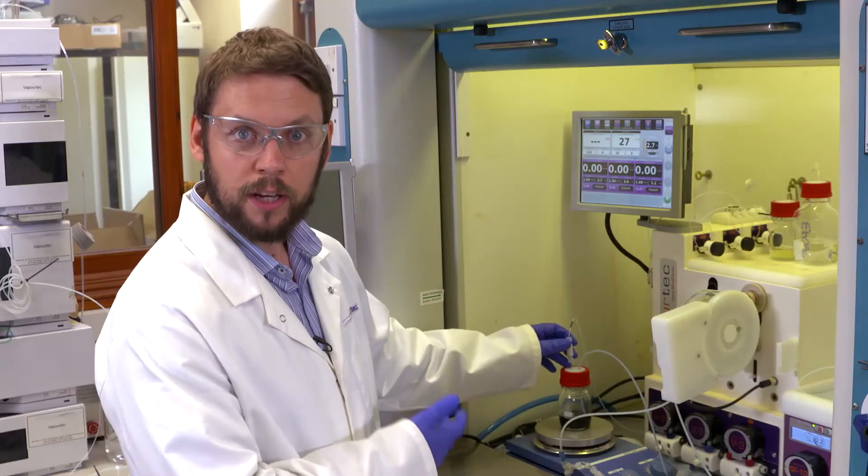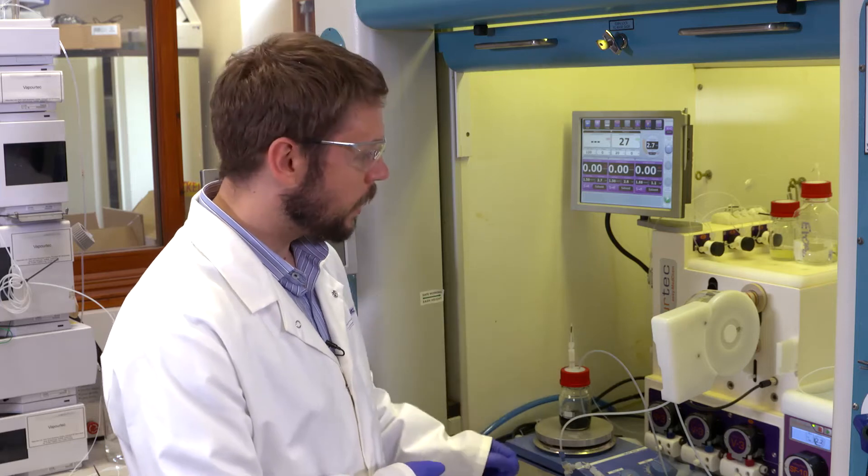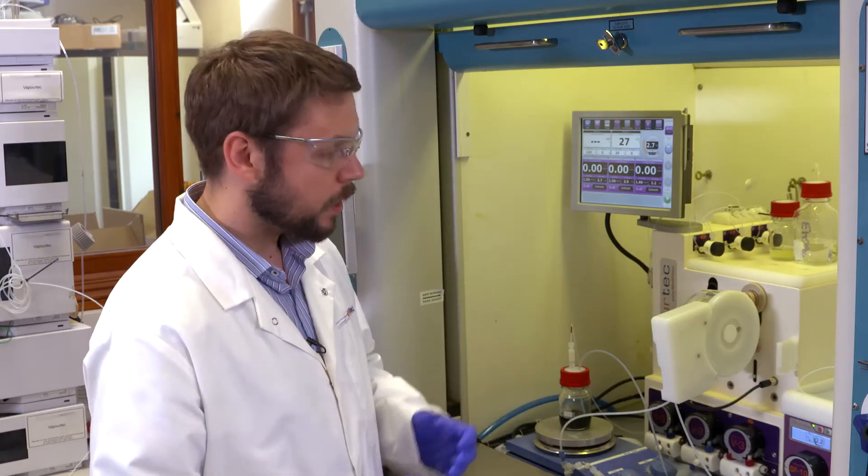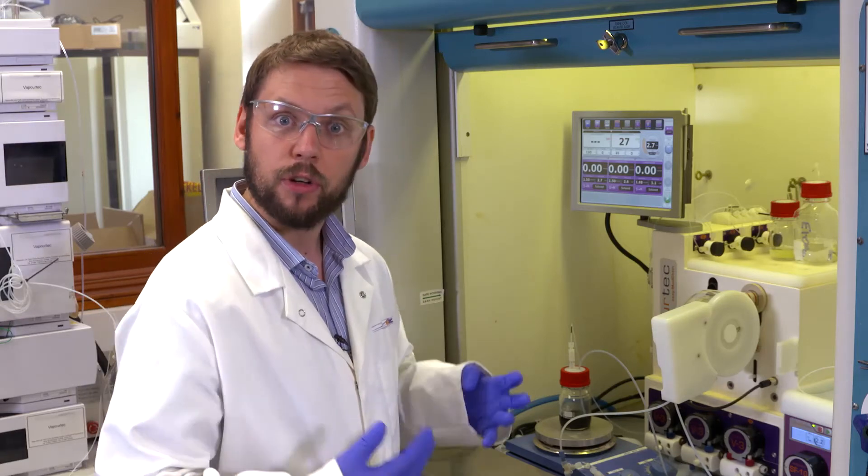I'm using nitrogen from our inert gas manifold to make sure there's no risk of fire and for this experiment I'm going to be using a 20 milliliter reactor for rapid mixing to make sure that the three phases of this reaction combine properly.